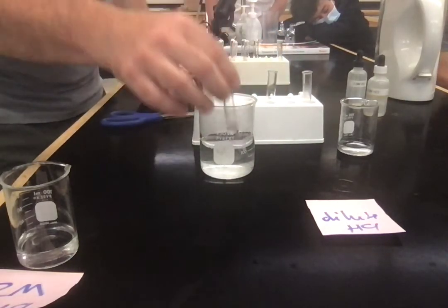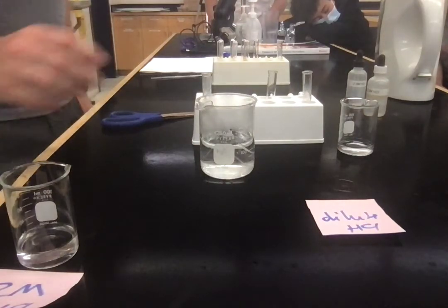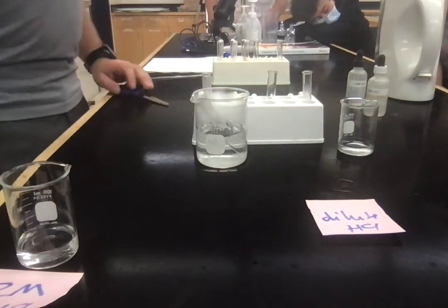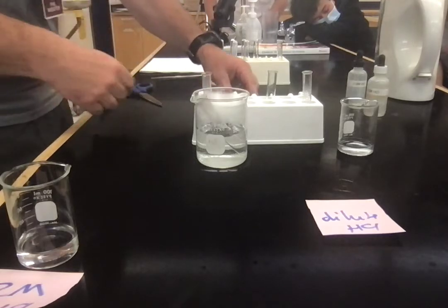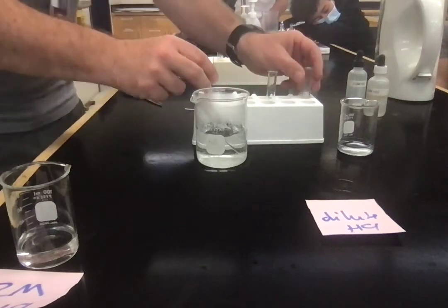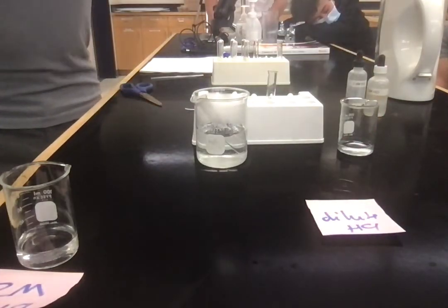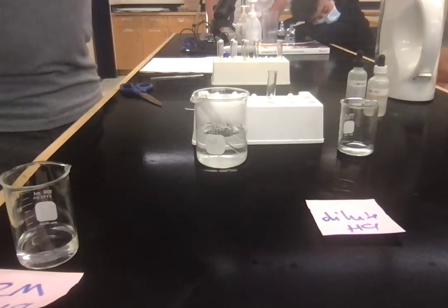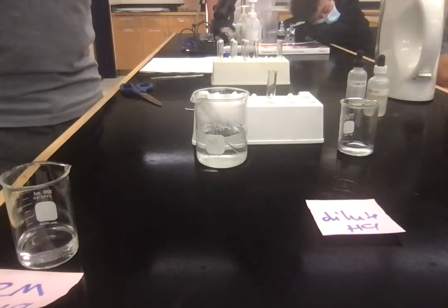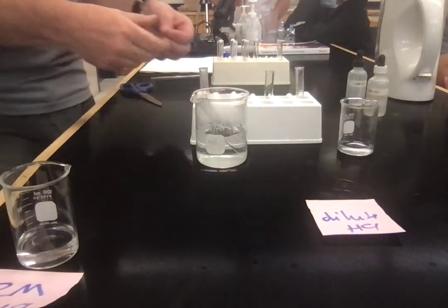This time, I'm going to put one of them in hot water. I'm going to have to probably leave that there for a little bit. Why? So it can warm up, so the heat can transfer. Good. If we go back to the concentrated and the dilute, in the concentrated the magnesium's almost disappeared, and this one's still sitting at the bottom looking pretty much normal. So it takes longer to dissolve. Think about that when you're thinking about rates.